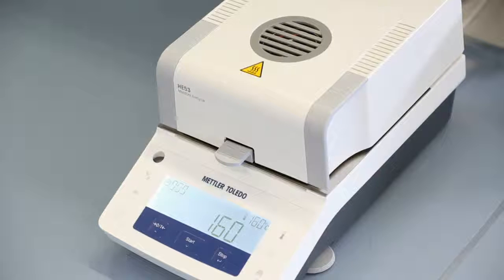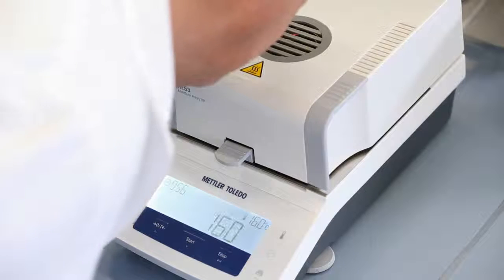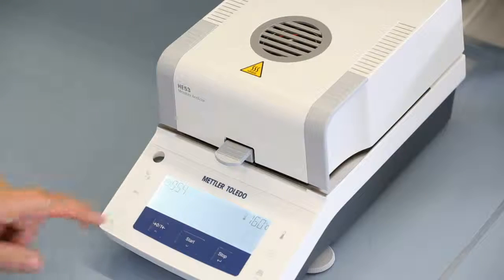After inputting the second temperature, the adjustment process is successfully completed.